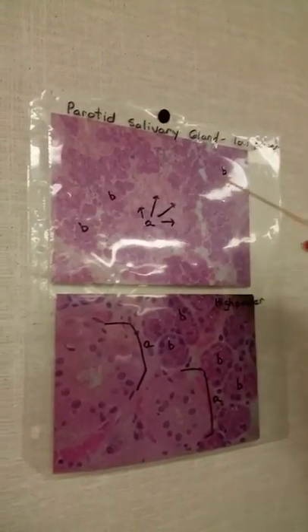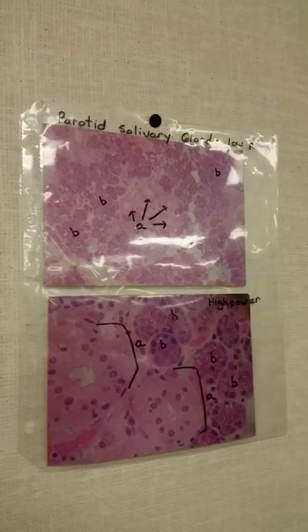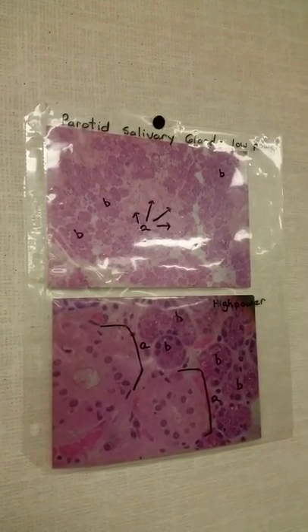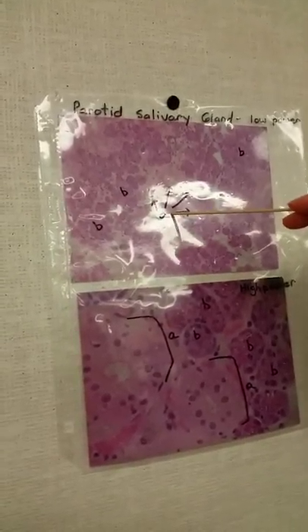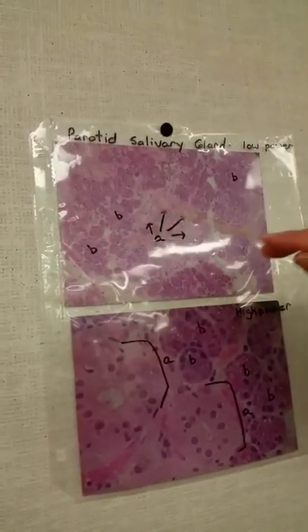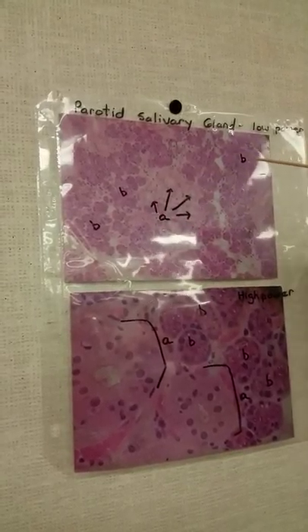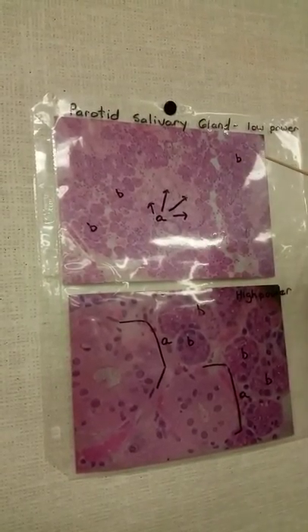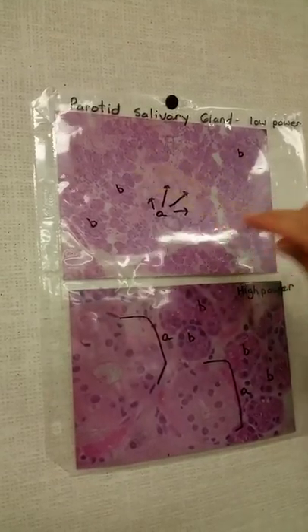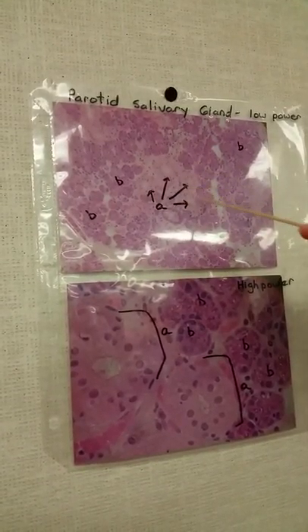This is the parotid salivary gland slide on page 1, chapter 25. For this part here, it would be the salivary duct — it's lighter. And then for part B, it would be the acinar cells. It's darker than A, which is the salivary duct.